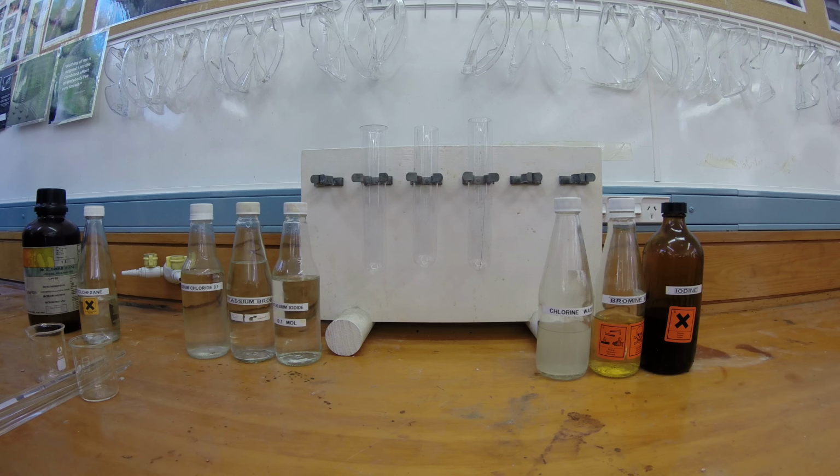Okay, so what we're going to do is from the 6 reactions you did before lunch, well, the 6 experiments you did before lunch, because not all of them reacted, right? Only 3 of them did. We're going to do those 3 that did, and we're going to show you a way we can identify the products. We know that the ones on the top part of your results table reacted, so chlorine and potassium bromide, chlorine and potassium iodide, and bromine and potassium iodide all gave us some sort of change.